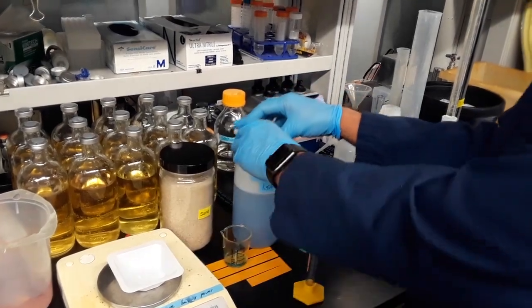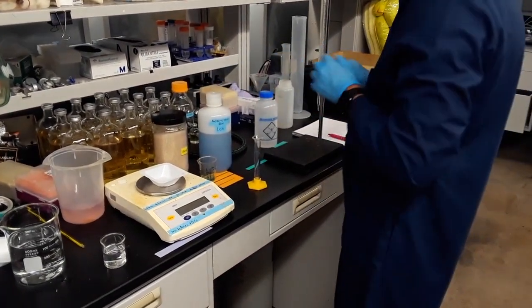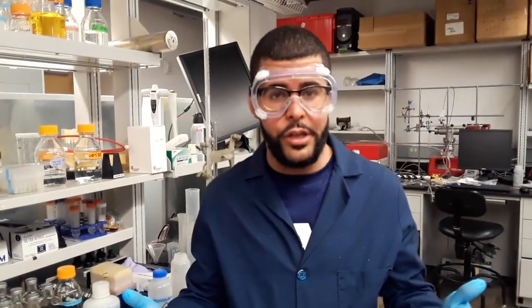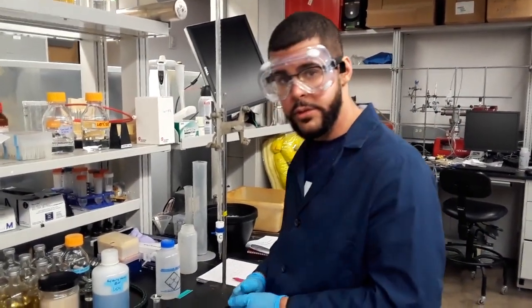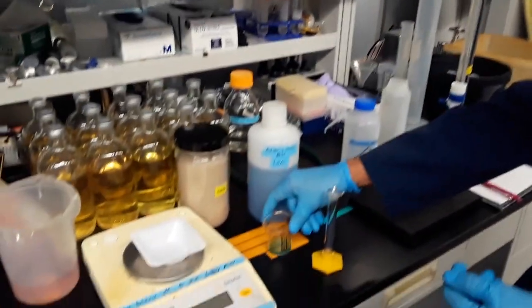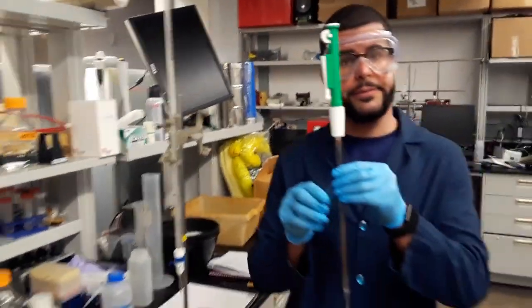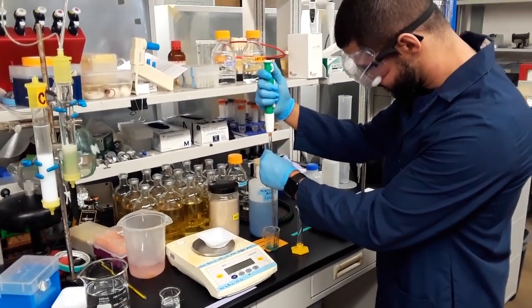And we're going to be doing a few trials of this. Keep that in mind. We're going to be doing the 0.3 molar, the 0.75, and we're going to have the 1.35 molar as well. So you want to have a little bit more dye, that way you can just continue taking out volumes as needed. So if we go back here, using my graduated pipette, I'm going to take out 2 milliliters of the dye.